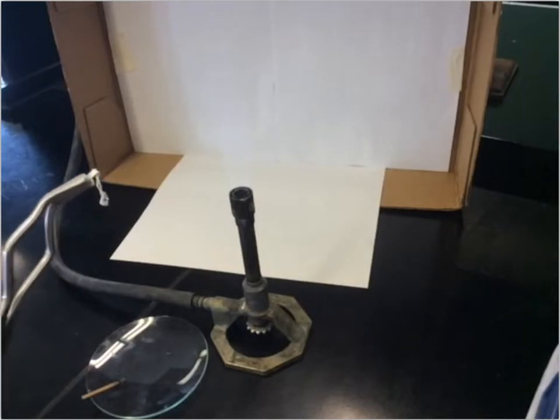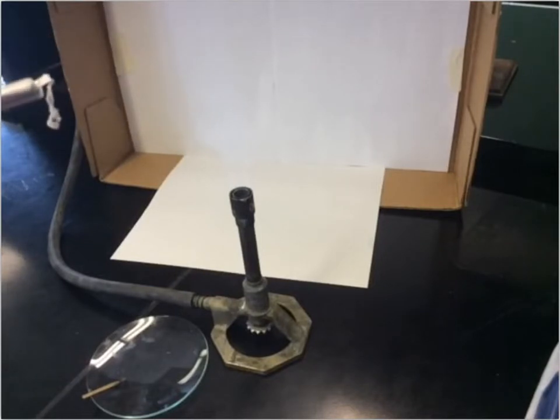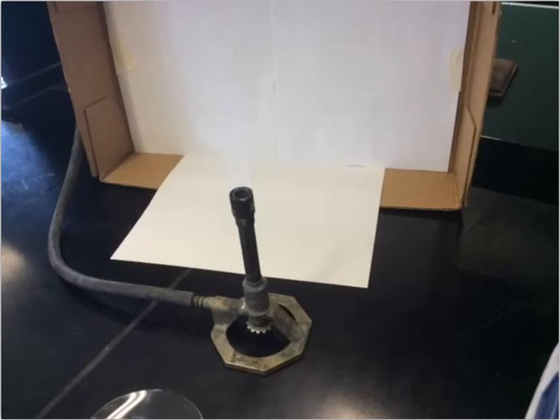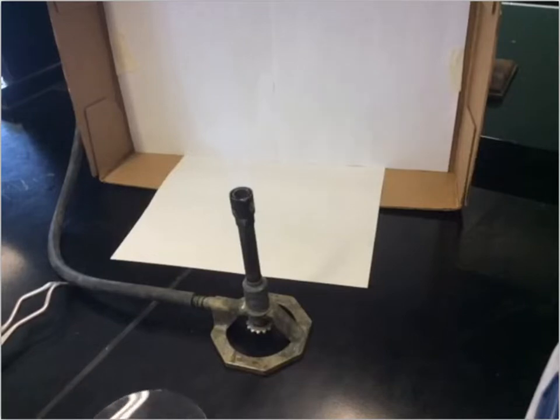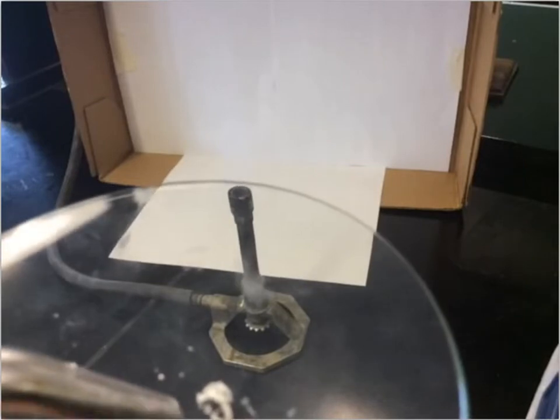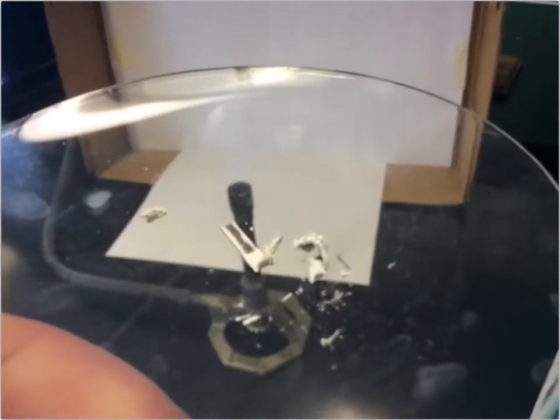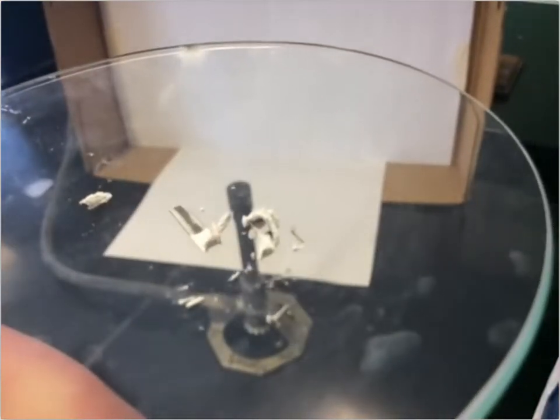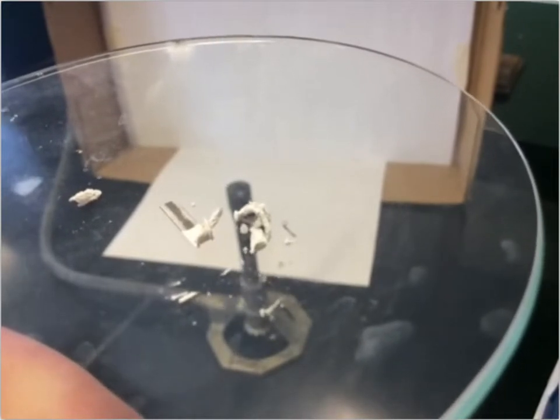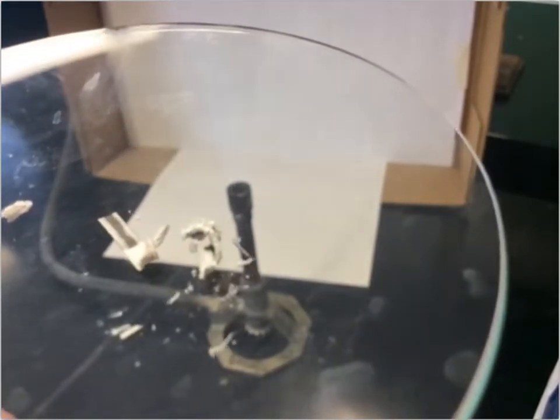That was our reaction. Let's look and see what's left of our magnesium ribbon — I'll put it down on the watch glass. What's left is just some ash, and the piece of ribbon I was holding with the tongs that I didn't let burn all the way down. You can see that white ash that remains and that one little piece of magnesium ribbon.